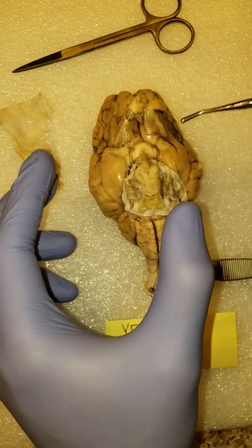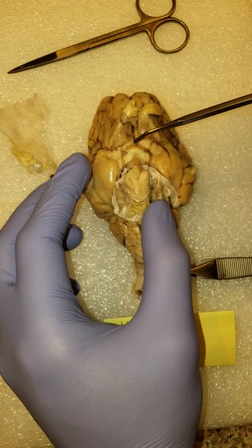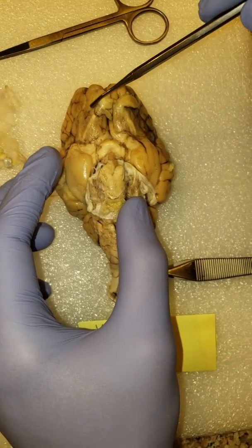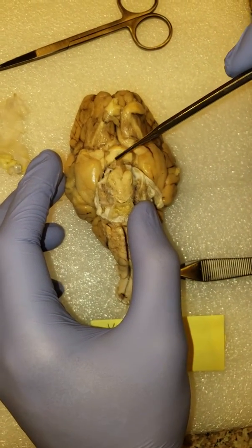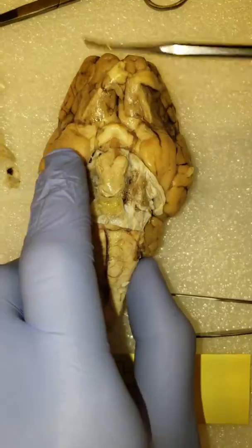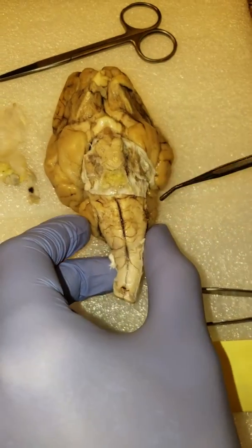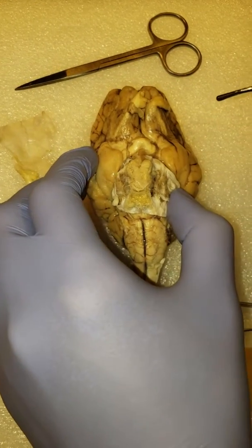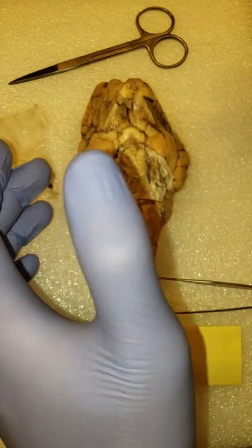We've also got this small little X-shaped landmark here, and that's better known as the optic chiasma. Normally there would be two optic nerves going from the top of this X, and below them would be the optic tracts. Of course, the midbrain is in this. Actually, the midbrain is better seen, like I said, with a better view from separating the cerebellum. And the cerebellum we can still see from this side. The meninges we already touched on. What else? The parietal lobes. I think that's mostly it.